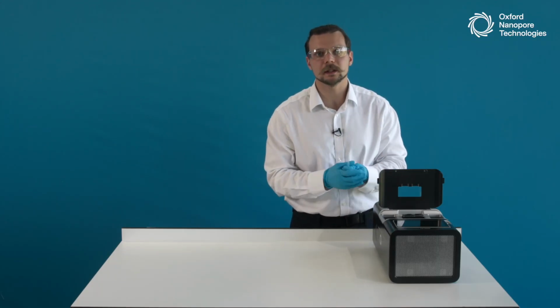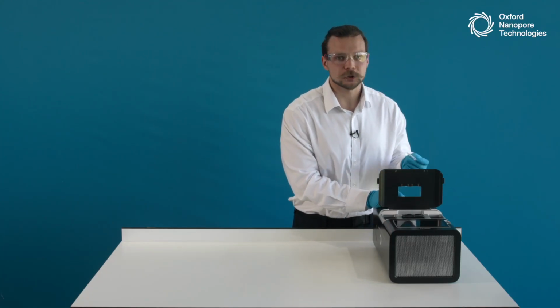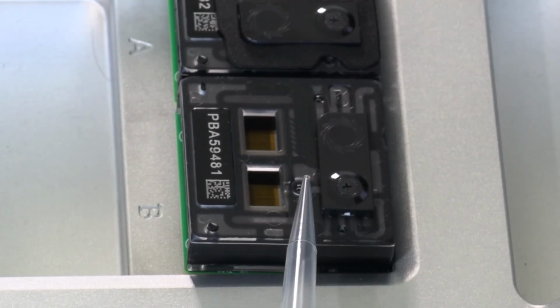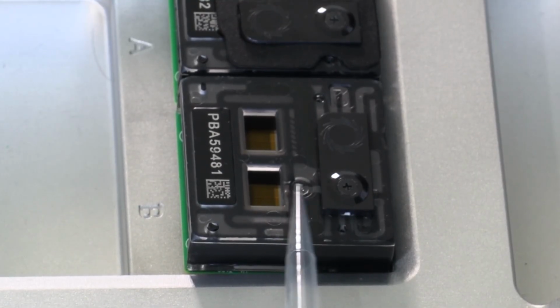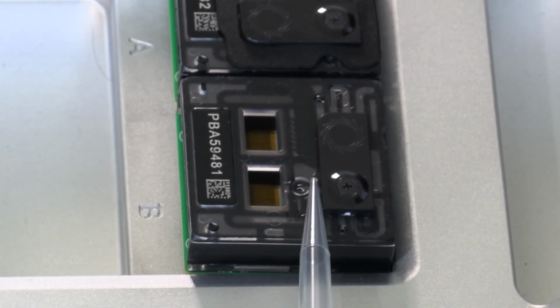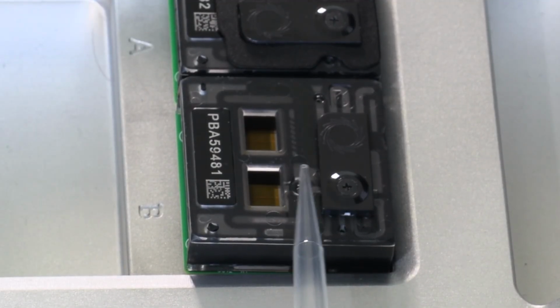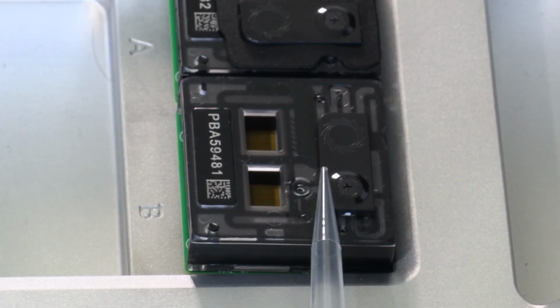To interact with this sequencing array, there are three main ports on the flow cell through which the user can interact with it. The main channel through which we will be priming the flow cell and loading our DNA sample is the priming port that is located under the valve that I've just rotated. This is the main port through which we will interact with the array, load our sample. And if you're only using the flow cell once, if you're only loading the library once, this is the only port you need to interact with.